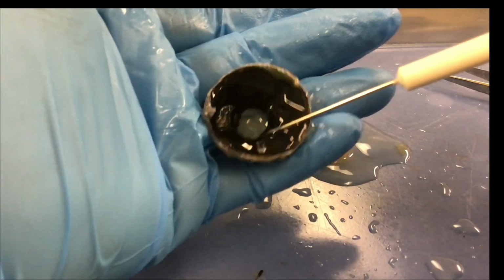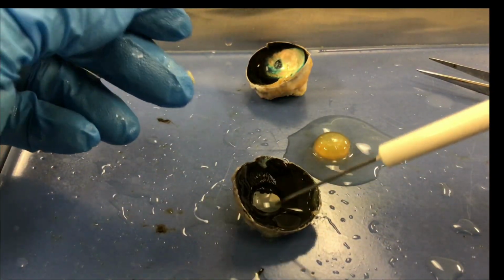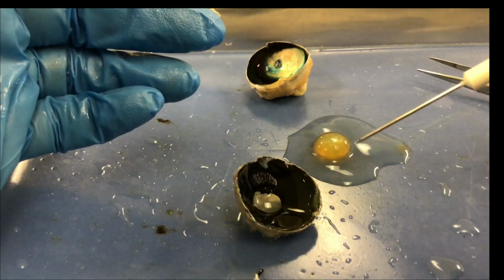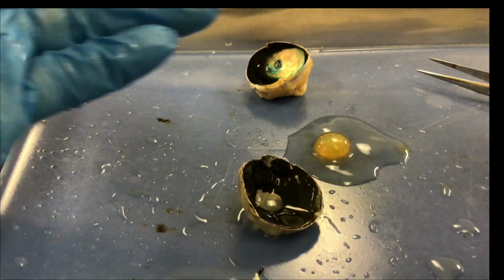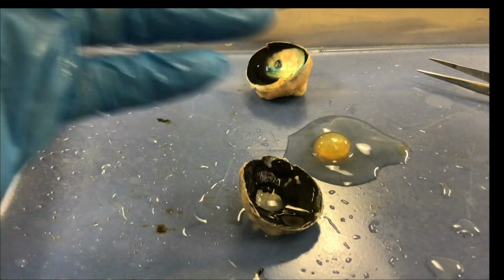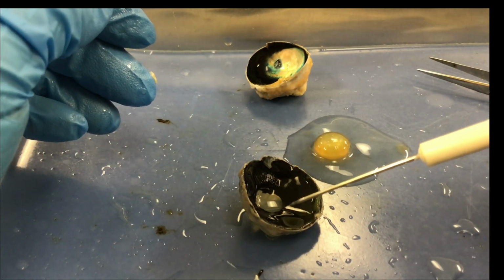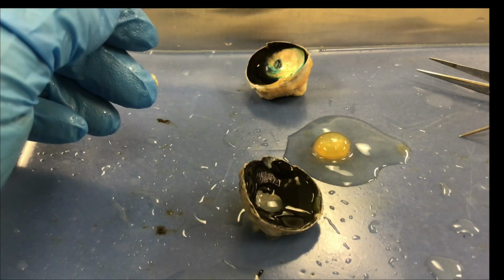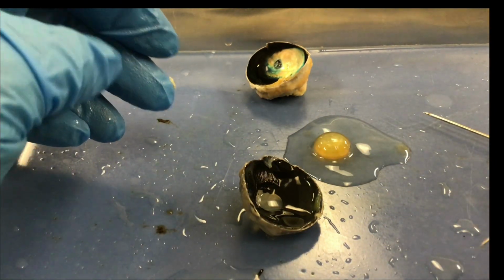The ciliary muscle is the second intrinsic eye muscle, and it controls the shape of the lens. So it'll either make the lens very flat or very bent, and that bends the light coming into the eye. The ciliary muscle and the iris are smooth muscle, and they are controlled by cranial nerve number 3, the oculomotor nerve.